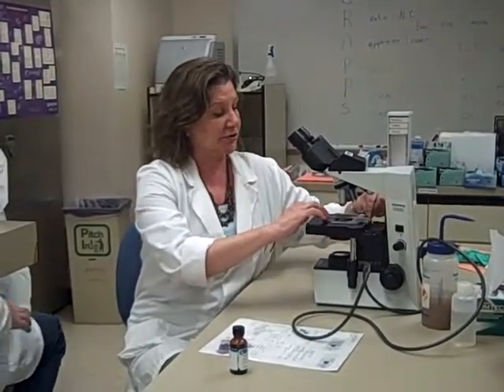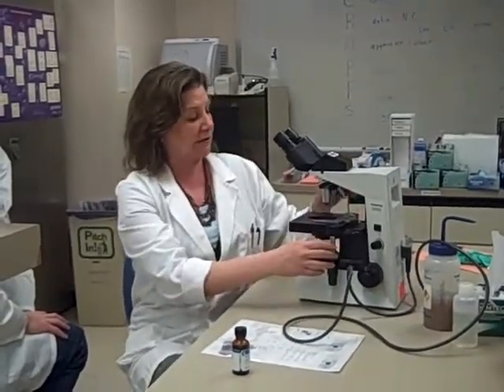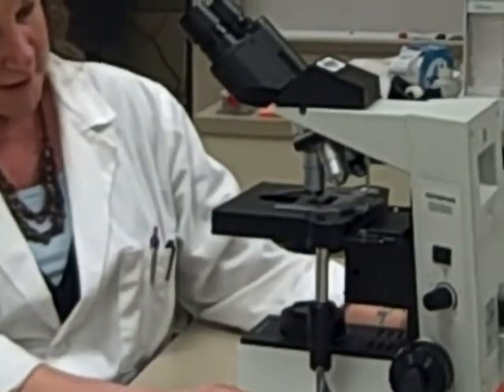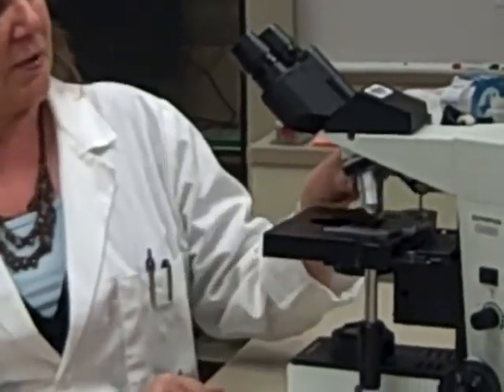You're going to put your slide on, and remember we talked about that, three-quarters area right there. This is the prime area for doing your differential. So you're going to put your slide on, and it's plugged in, and you can see we're a ways away from being in focus. One of the tricks of focusing in here is if you take your 40 and you bring it over and bring up your stage to where your 40 is just over your slide, you're going to be very, very close to focusing. We're going to turn it to 10.